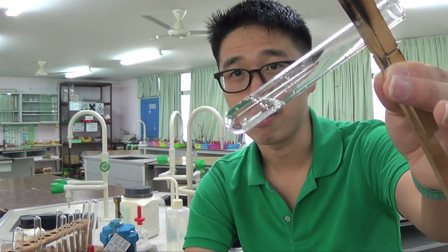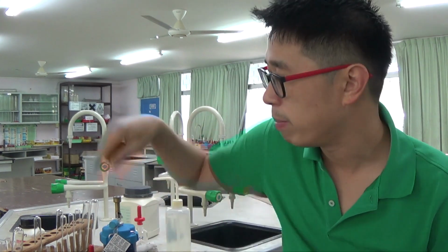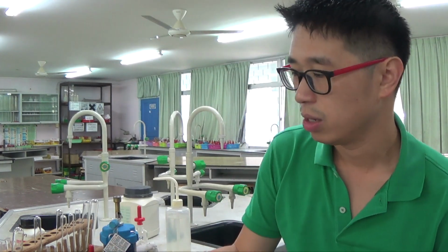We are testing for carbonate, so you need to add acid: dilute hydrochloric acid, dilute nitric acid, dilute sulfuric acid. Any acid will react with carbonate to give you carbon dioxide gas, but carbon dioxide is colorless. You see effervescence, there is your observation. You test for the gas by bubbling it through lime water. Lime water is also provided in your exam.